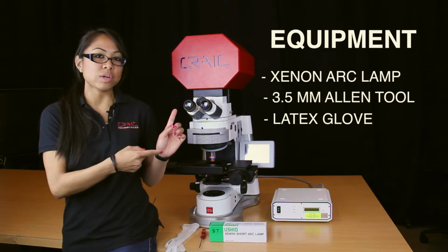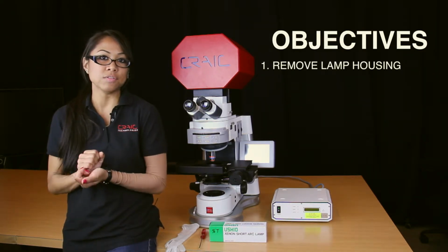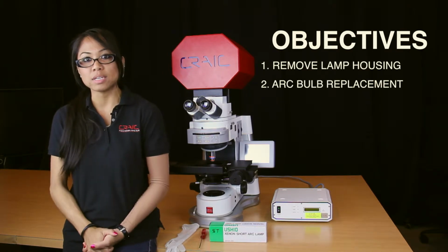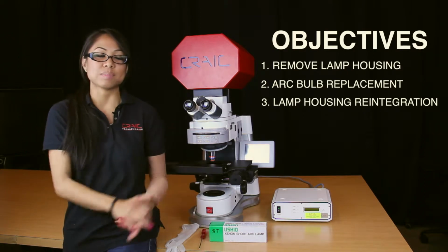So we're going to go ahead and swing right over to the side of the MSP. I'll show you how to properly remove the lamp housing from the unit itself, how to remove the bulb from the lamp housing, and how to properly replace the lamp housing onto the microspectrophotometer.